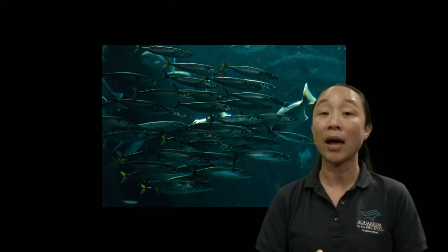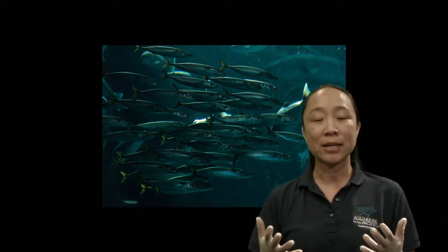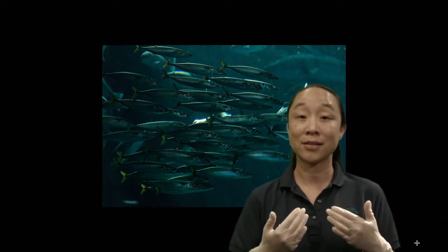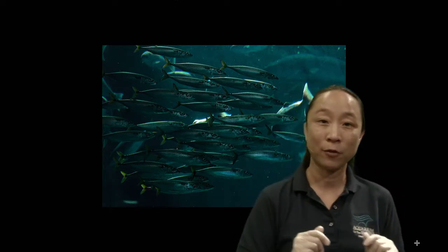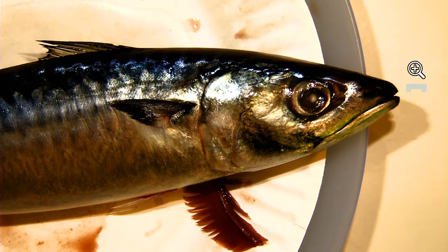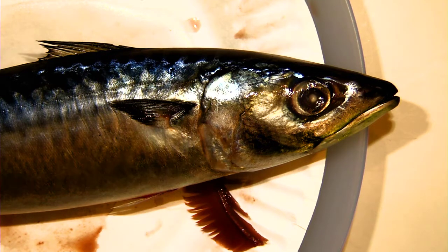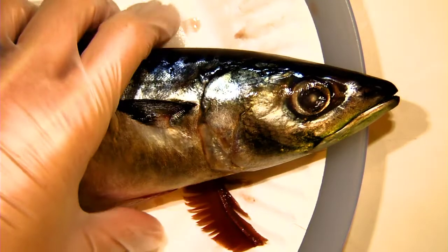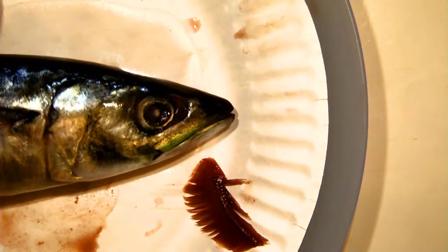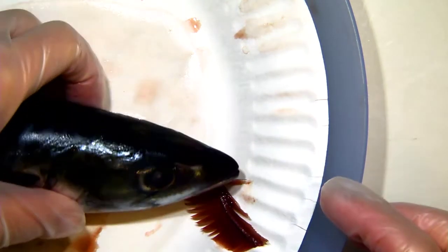In a way, the lateral line is kind of like the sense of touch, and they do respond to touch — if you were to touch a fish, it would know. Other senses these fish have are very similar to us. They can feel touch. They can see — they definitely have an eye. Fish eyes are better for looking at things underwater, not so much in the air unless they have very special eyes. Some fish can smell. Smell and taste are really similar — they're basically detecting chemicals in the water. Even for us, smell and taste are similar: have you ever had a stuffy nose and couldn't taste very well? Yeah, because they're kind of connected.